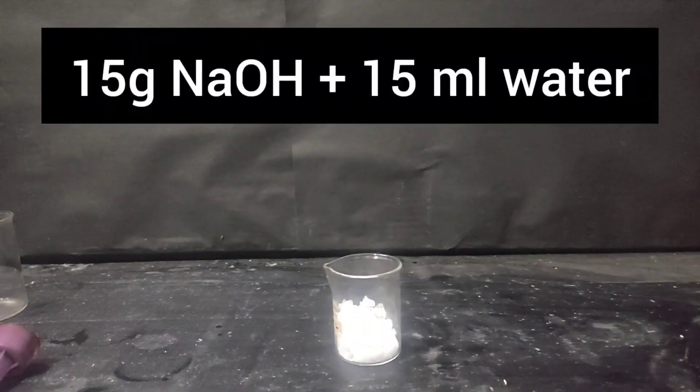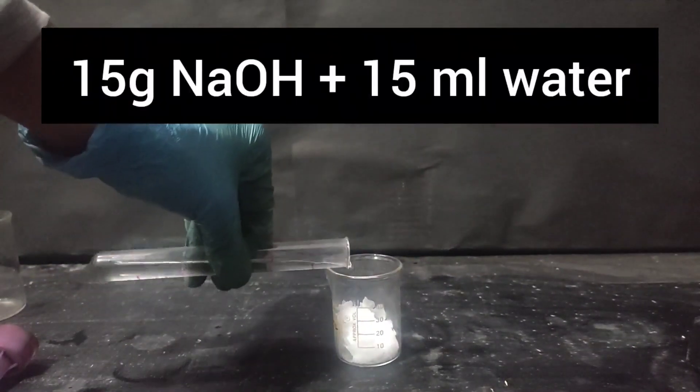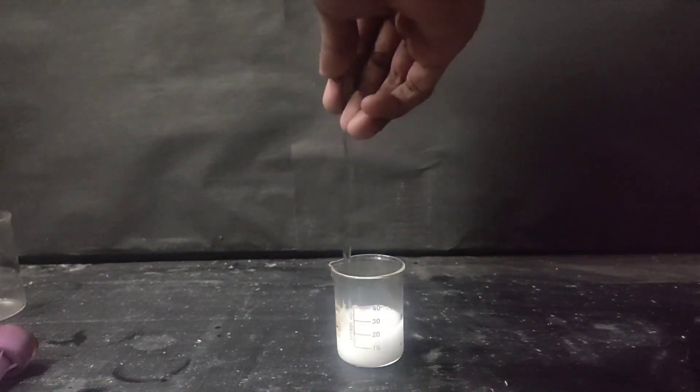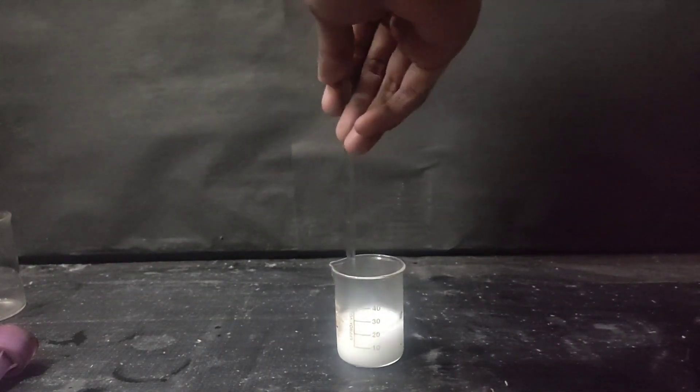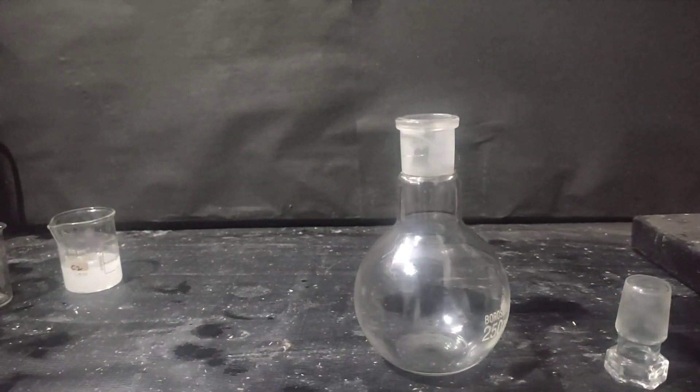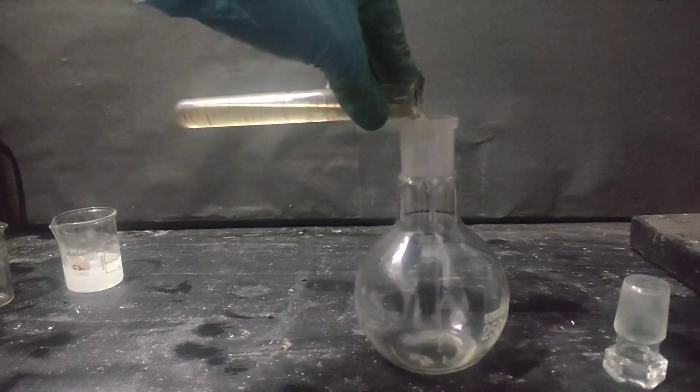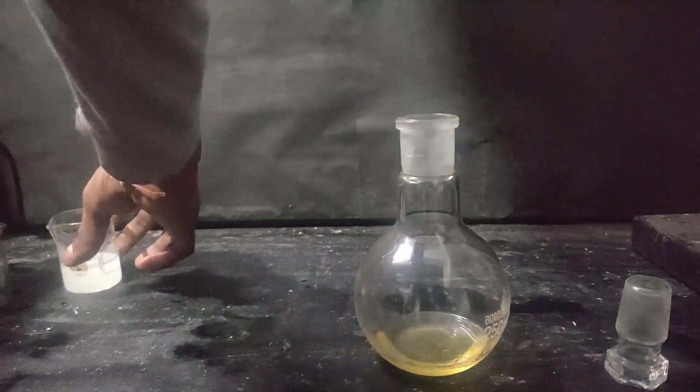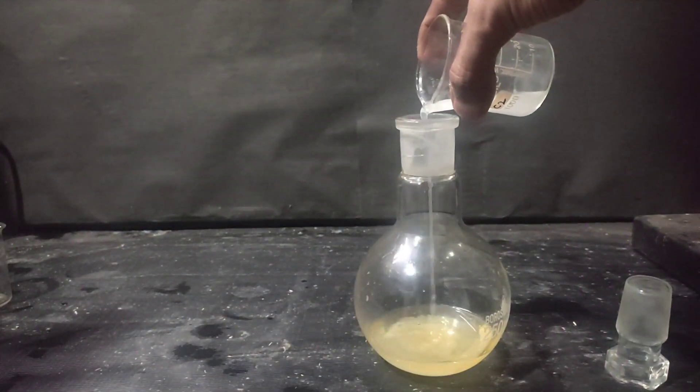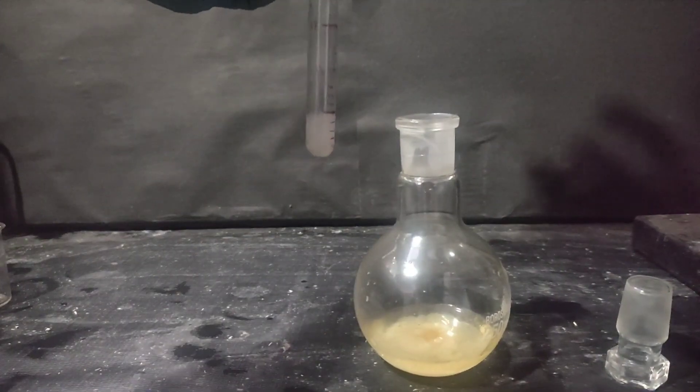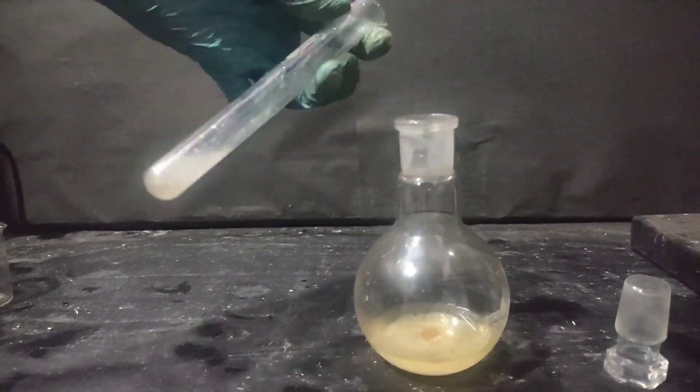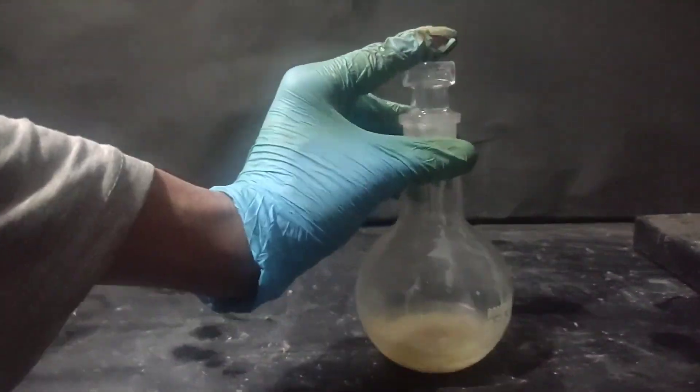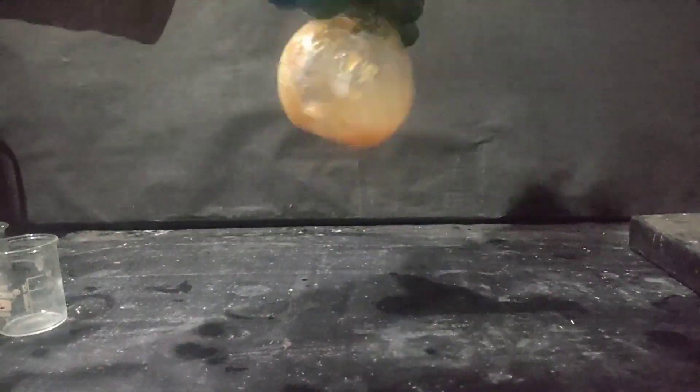Now I took 15 grams of NaOH and added 15 ml distilled water to it and stirred it with a glass rod and it was kept aside. Then I took a 250 ml flat bottom flask and added 18.5 ml benzaldehyde in it. To the benzaldehyde I added my prepared sodium hydroxide solution. I also washed my test tube with it and transferred it in the flask. Immediately some white solid was formed. I stoppered the flask and shook it to mix everything.